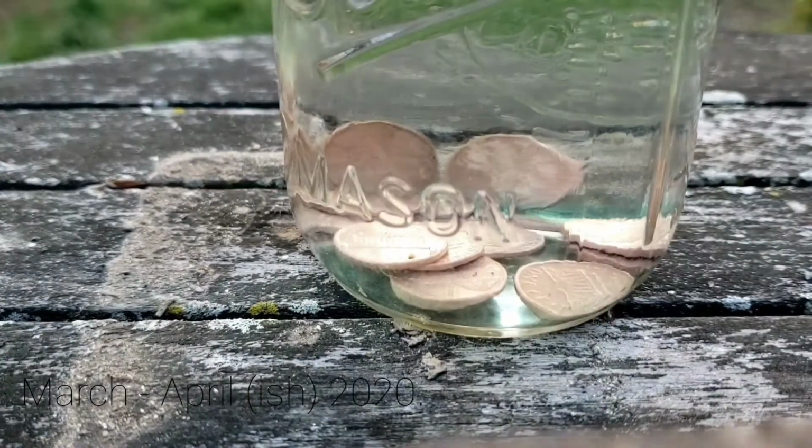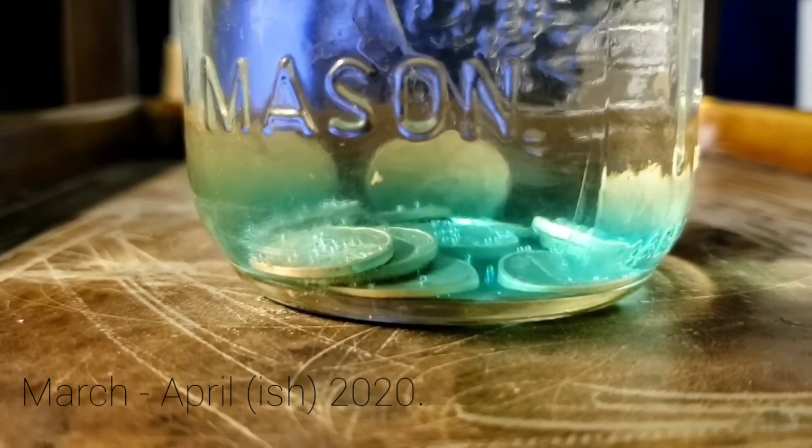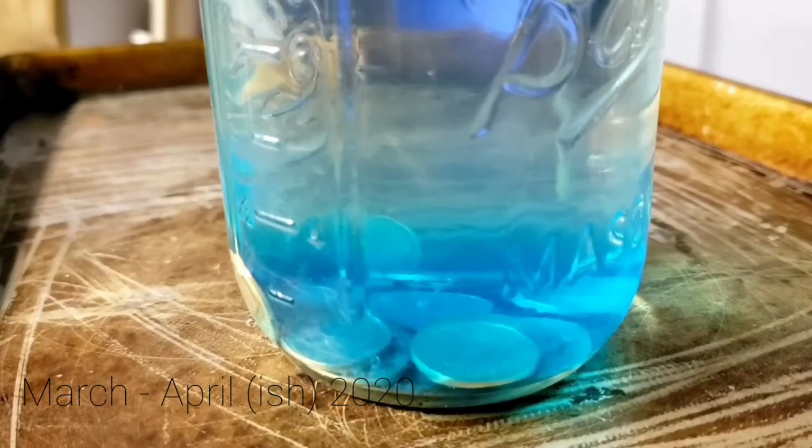But anyway, here's that. So to begin with, I didn't know that simply heating the solution would speed up the reaction a ton, so I genuinely just left it overnight and waited. And obviously that took a while, and also, thank you for noticing, I did do it in the mason jar. But as you can see, the product I got was completely the same, so the reaction itself went completely fine.